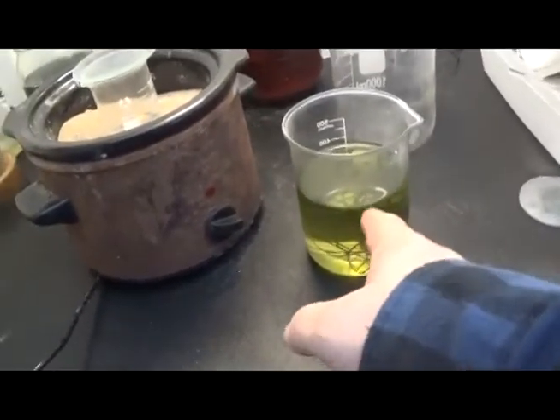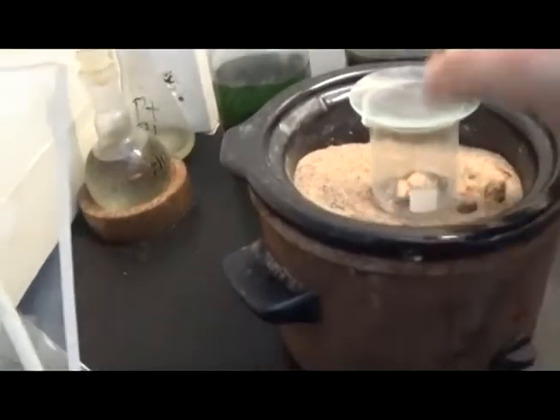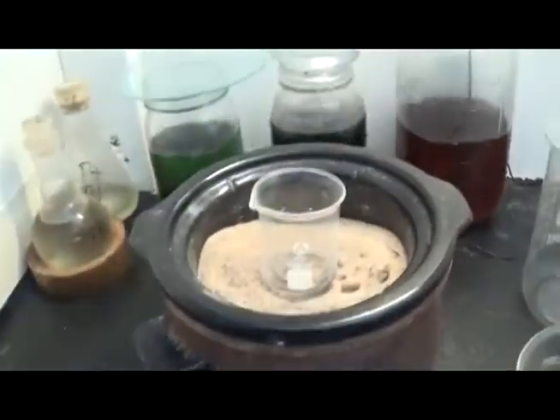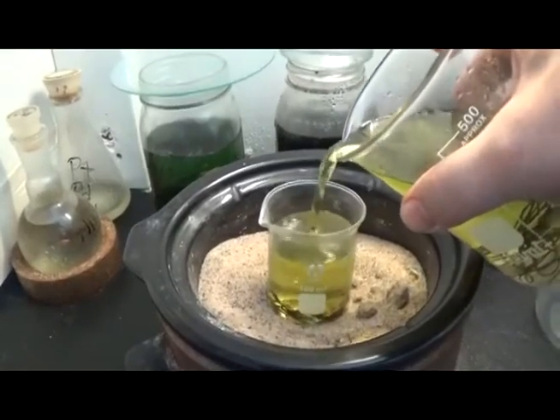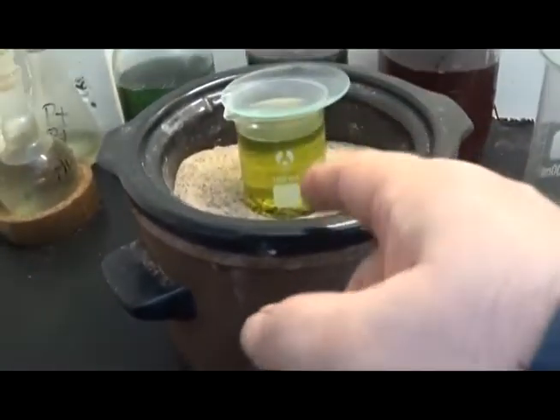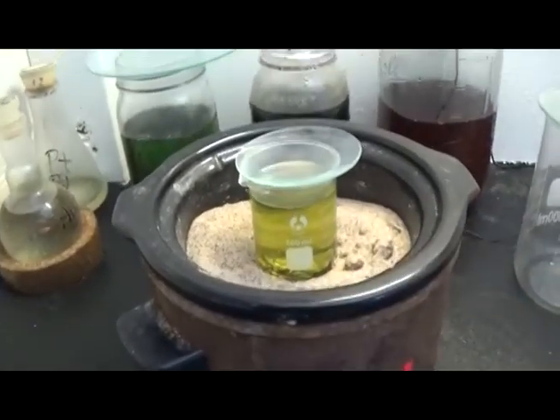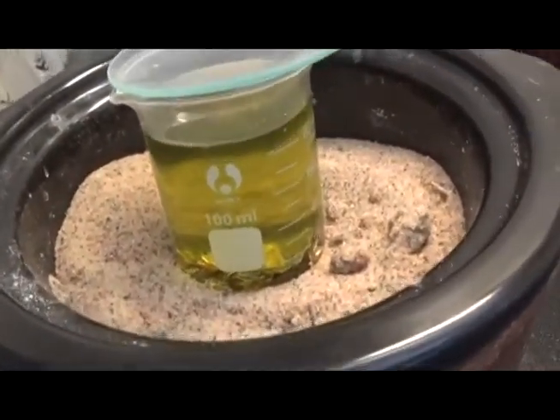We're gonna give it a go with this copper chloride — I think I called it copper chlorate earlier in the video. We're gonna add it to our sample gold-filled pieces; it's already showing good separation. We have washed the vinegar and sea salt, so we're gonna add a token amount of this — more than likely weak — copper chloride solution. We're gonna heat it up. I don't know if this is concentrated enough to do the job we want, but the copper chloride will eat out the rest of the copper base metal in the gold-filled material, leaving us just with gold foils. No nitric acid use whatsoever. But my gut's telling me it's not gonna be strong enough.